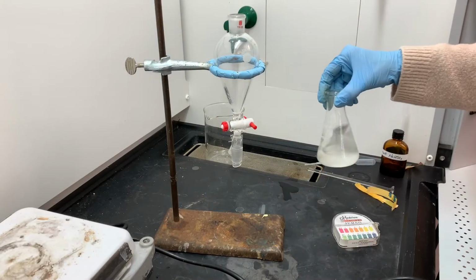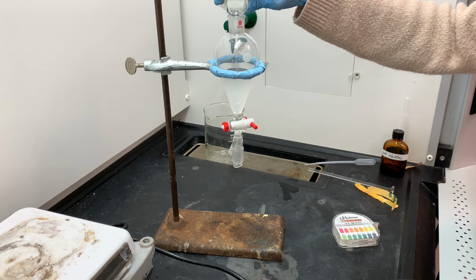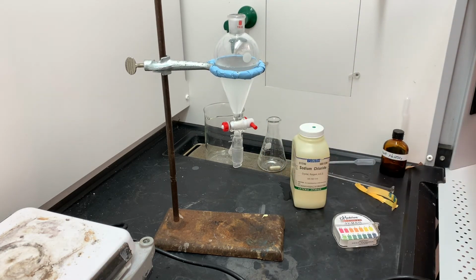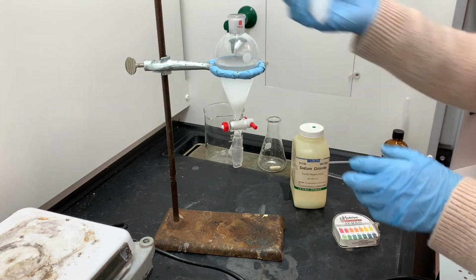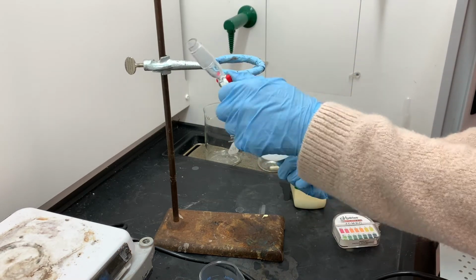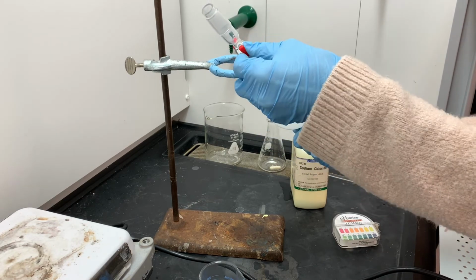It's time for the extraction. I'm going to transfer the product into the separatory funnel. Right now this is just the water, the product, and all of the different byproducts. And now I'm adding the approximately 6 grams of sodium chloride into the separatory funnel. And again, the only solvent that's in here at this time is just the water. So right now what I'm doing is increasing the polarity of that water. I'm shaking this up just for the purpose of dissolving the sodium chloride. I'm not doing any kind of extraction technique right now.